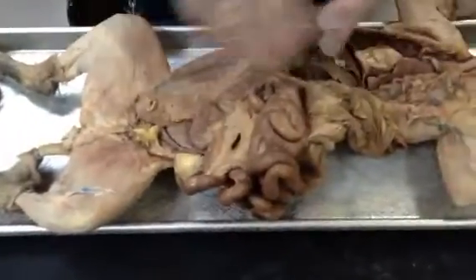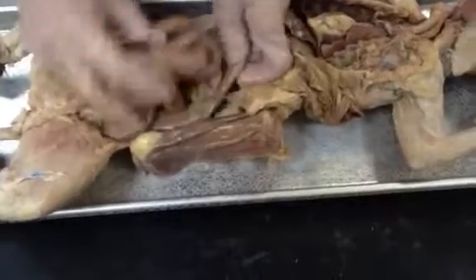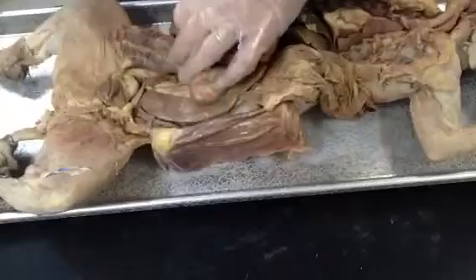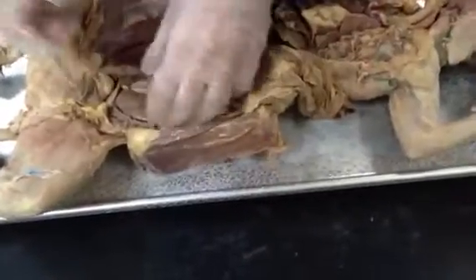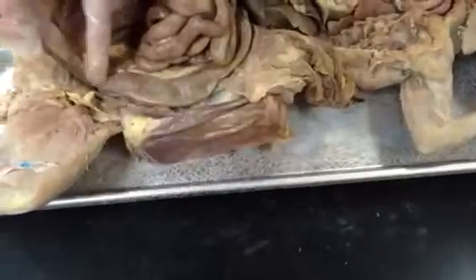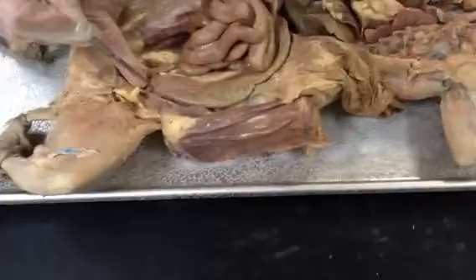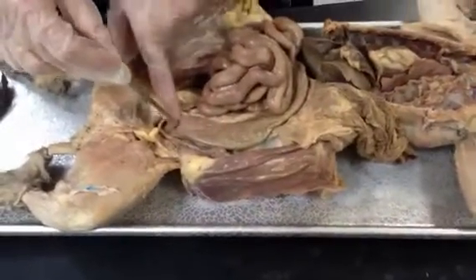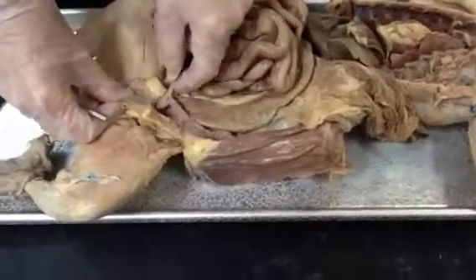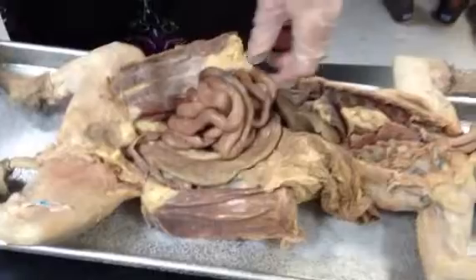Now I won't make you do the ascending, transverse, and descending because everything gets so mixed up here. But the last section of this colon, it's really not real curved. The last section before you get to the straight part was what, Jordan? The sigmoid. Sigmoid. So if I have a pin way down here, I want the sigmoid colon. And on this cat, you really can't see any of the rectum. So, you know, I wouldn't ask the rectum on this cat.